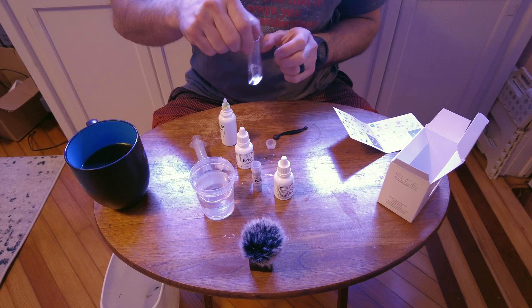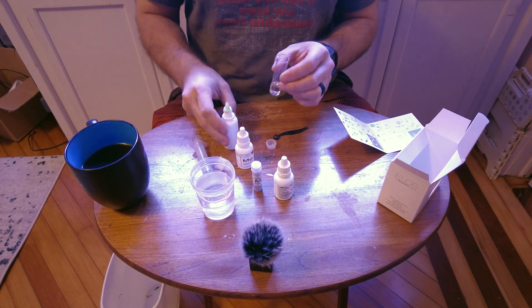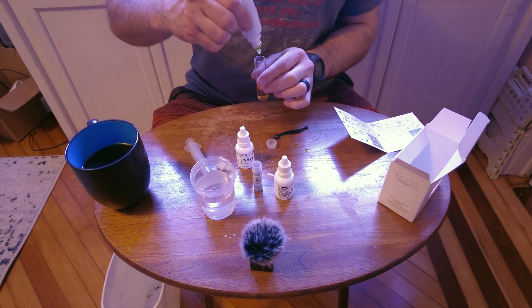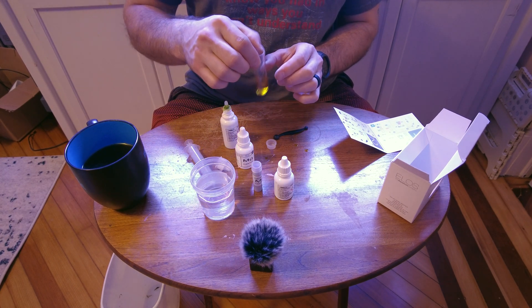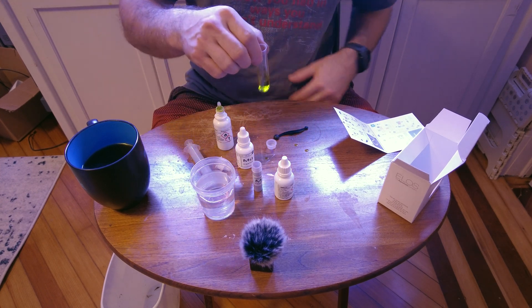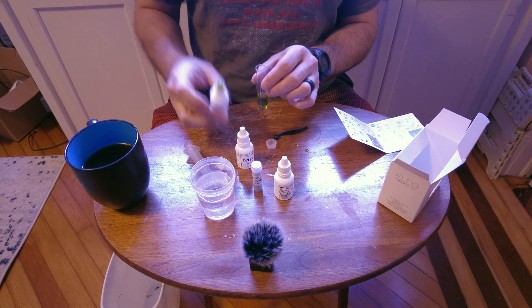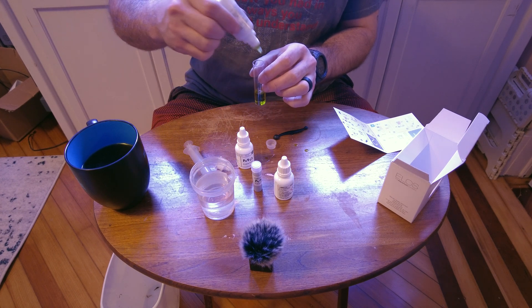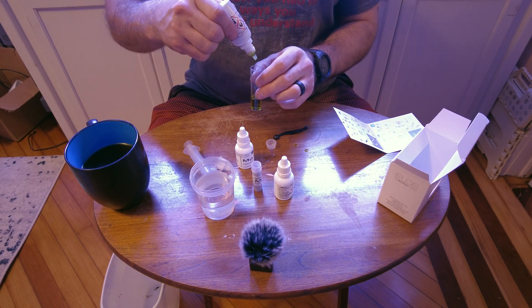I'm going to add a drop and stir, counting through. After about 26 drops, it started to turn at 27. At 28 it's still yellowy. At 29 it's going. At 30 it's pretty green.